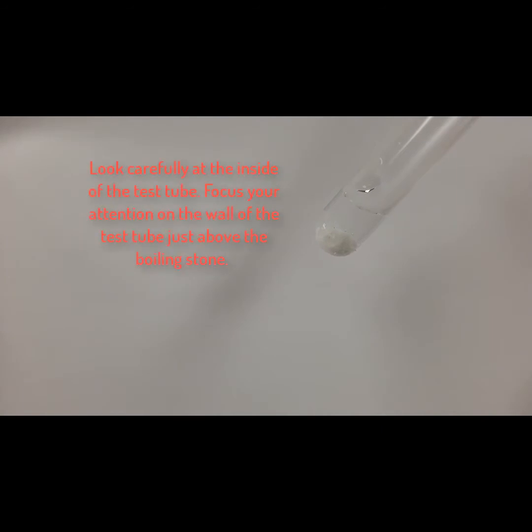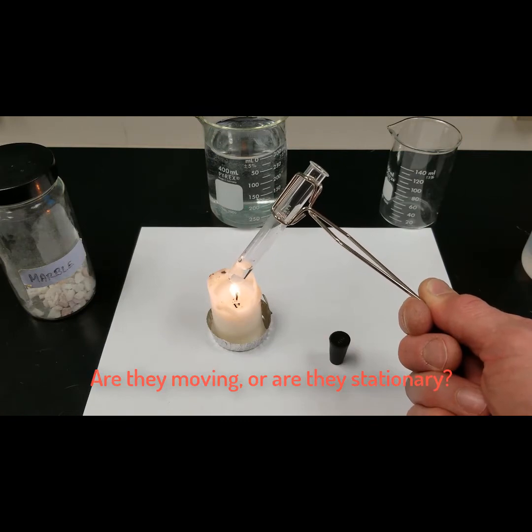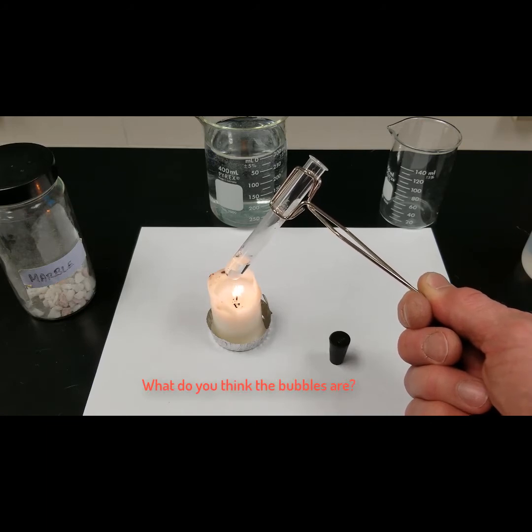Look carefully at the inside of the test tube. Focus your attention on the wall of the tube just above the boiling stone. You should see bubbles. Are they large or are they small? Are they moving or are they stationary? What do you think the bubbles are?